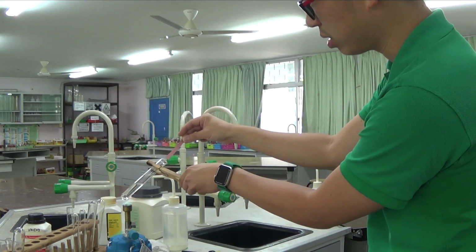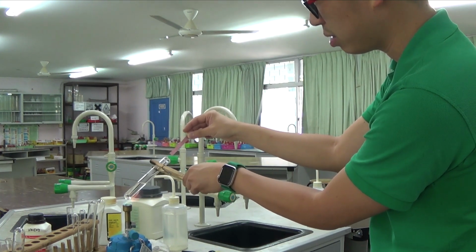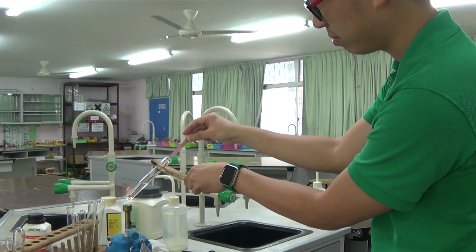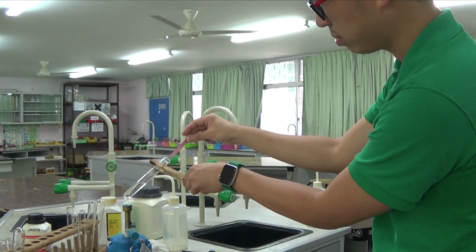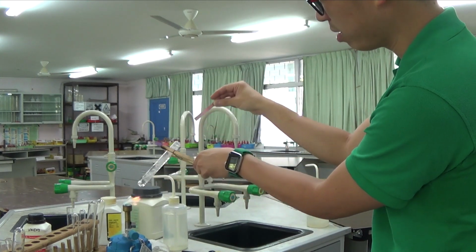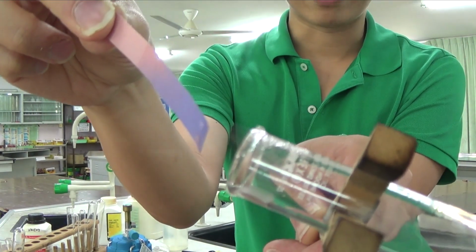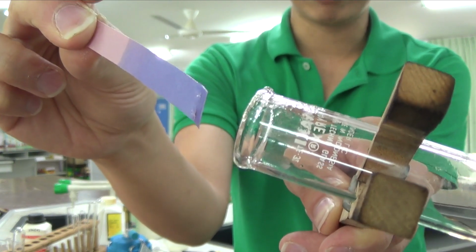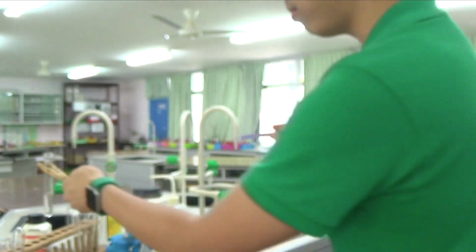There's a lot of solution, that's why it's taking a bit longer, or probably my solution is not too concentrated. That's probably why. Hopefully it will give me my ammonia gas. It's starting to boil now, and my litmus paper actually started to turn a little bit. But I do not want to let it touch the side. I hope you can see that there's a bit of gas being given out, and as you can see, the gas being given out has slowly turned my litmus paper blue. I hope that's very clear. I'm not touching the inside because I do not want to test for sodium hydroxide.